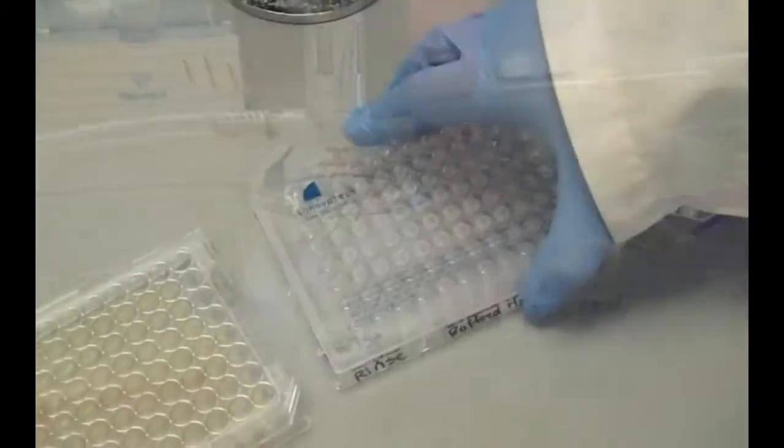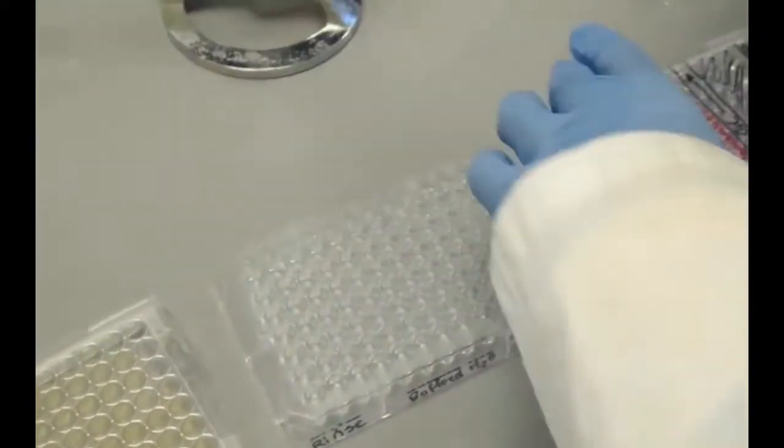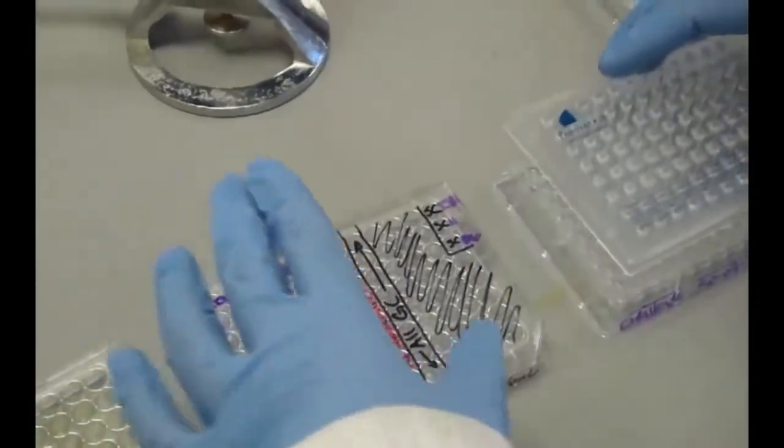The peg lid is then transferred to the challenge plate and incubated for the manufacturer's recommended disinfectant contact time and temperature.